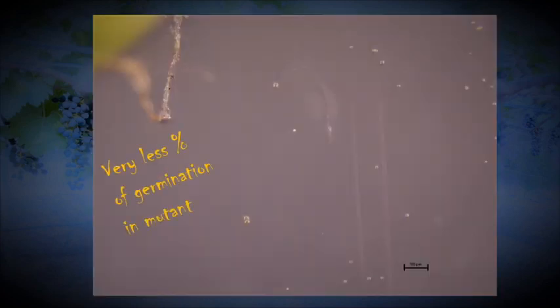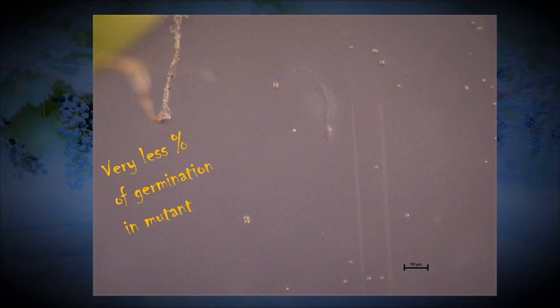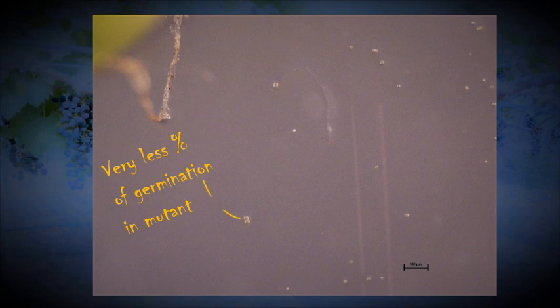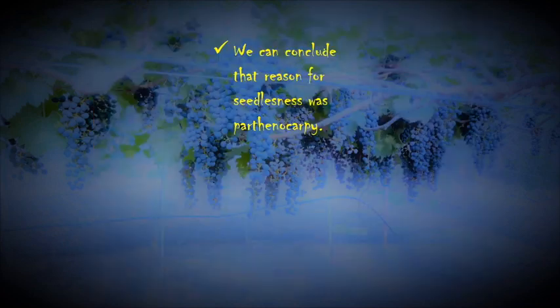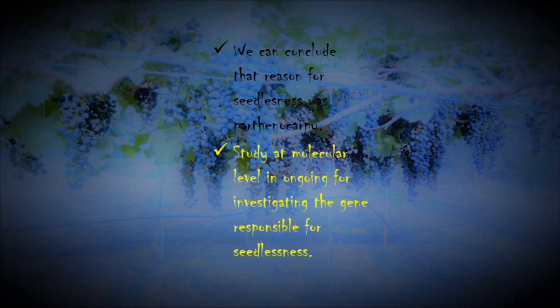From the above experiments, we can conclude that the seedlessness in our mutant is due to Parthenocarpy. Further study at the molecular level for investigating the genes responsible for seedlessness is currently in process.